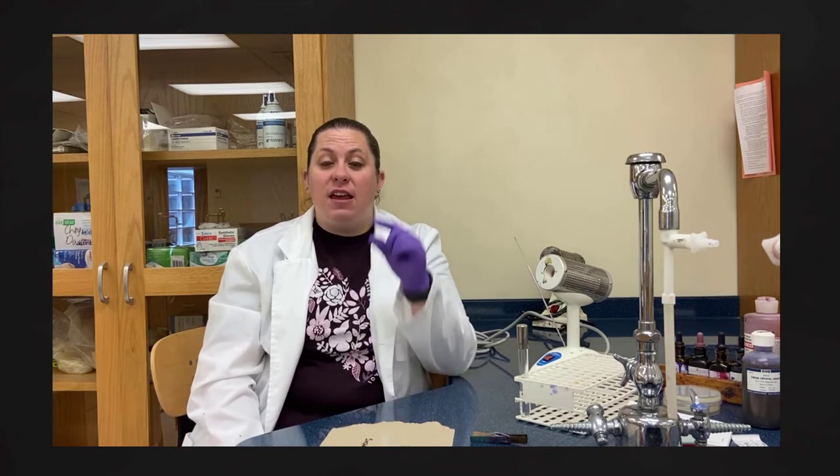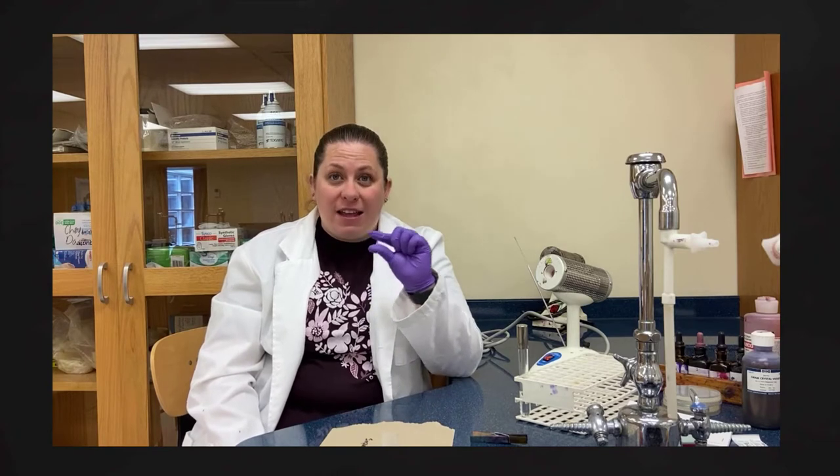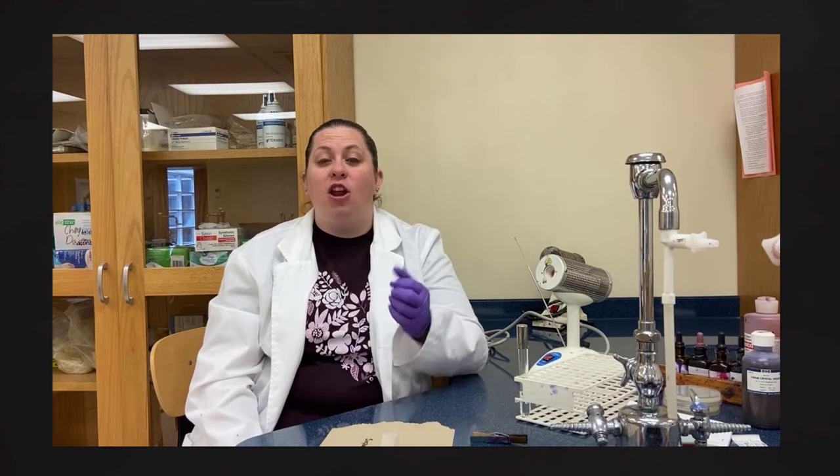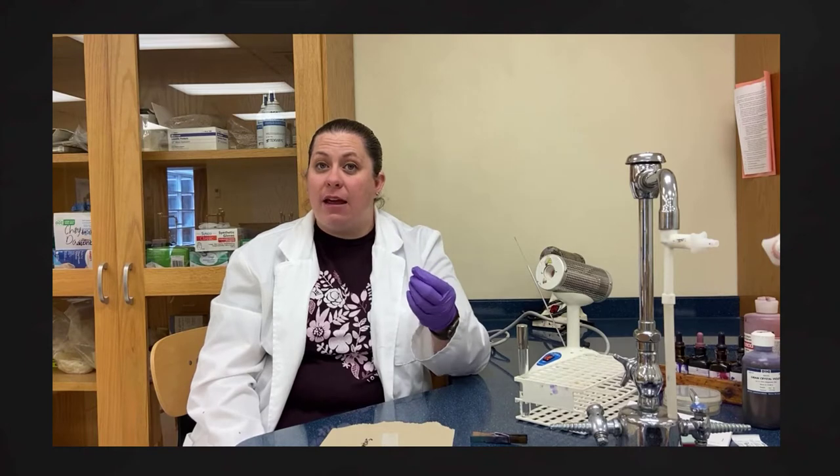Specifically, it's based on the layer of peptidoglycan present. If there's a thick layer of peptidoglycan, it's going to hold the first stain, called crystal violet, and that's gram positive. On the other hand, if it has a thin layer of peptidoglycan, the counterstain — safranin — is what's going to be held, and that indicates gram negative with the thinner peptidoglycan layer.